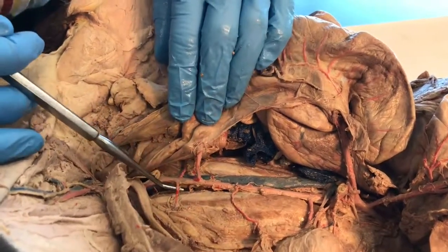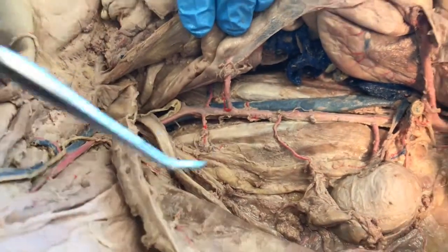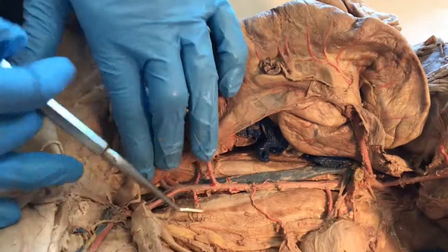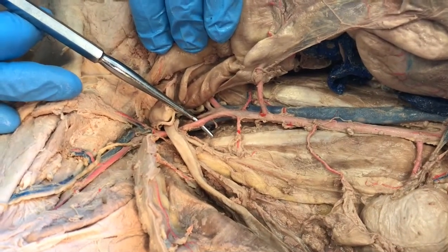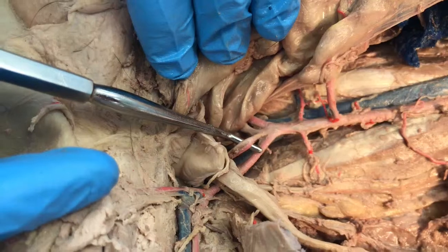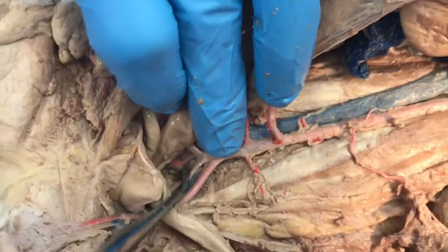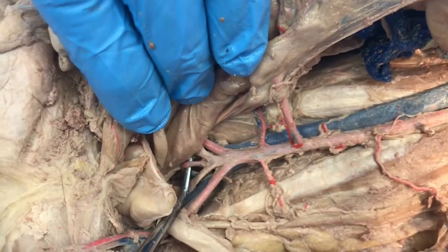A little bit further down we have the iliolumbar artery — this is the left iliolumbar artery. Remember the iliac crest of the hip goes around the pelvis, and this artery is named for that crest. Further down we have the external iliac artery — the left external iliac artery — and just below it, the left internal iliac artery. Right in the center, at the sacrum, we have the caudal artery — 'caudal' meaning tail — going in the exact same direction as the tail.